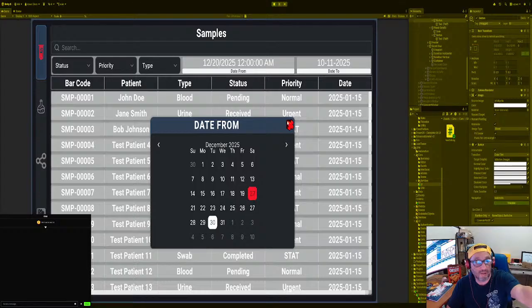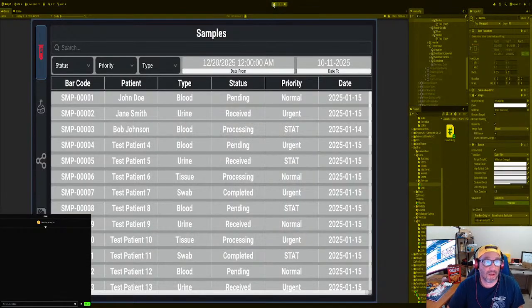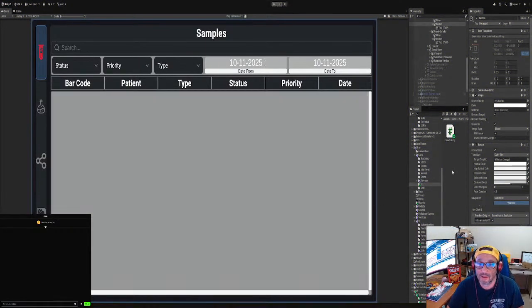The date changes. Okay, now we're gonna add an event. It's over here. So when this updates right here, when this updates right there, that it updates the actual list. How's that? Okay? All right. So let's go back in here.